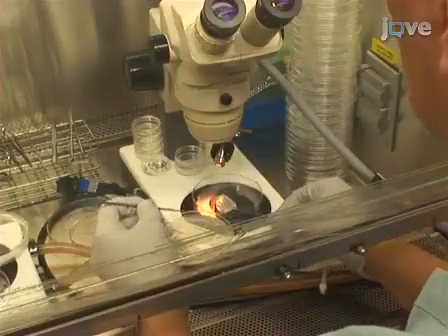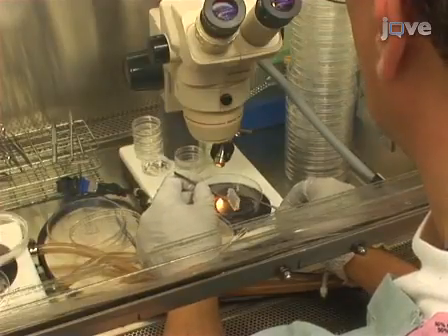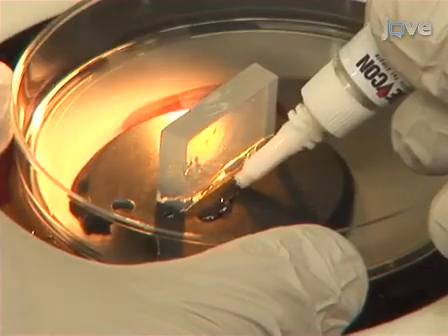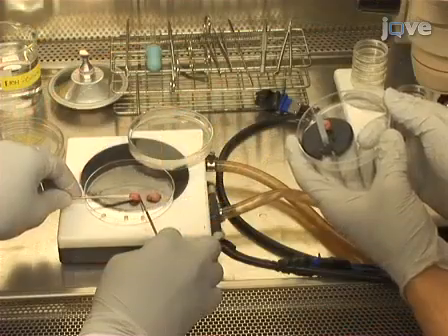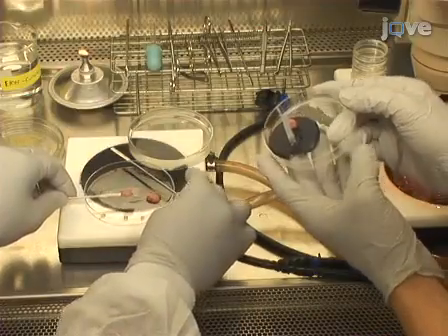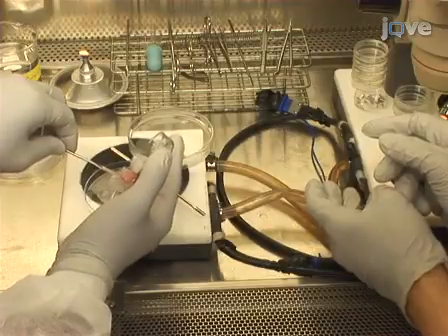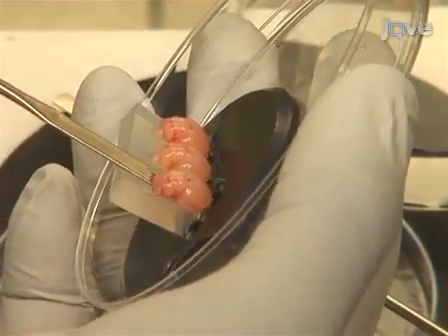Now, glue an agar block onto a mounting disc for mechanical stabilization of the brains during the slicing procedure. Then place a thin line of superglue a few millimeters in front of the agar block on the disc, but avoid having the glue touch the agar. Using a small spatula, transfer and mount each brain frontal pole down. Ensure that the frontal poles are glued to the mounting disc and that the ventral sides touch the agar without any glue residue. This assures proper mechanical stabilization during cutting and easy lift-off of cut slices.